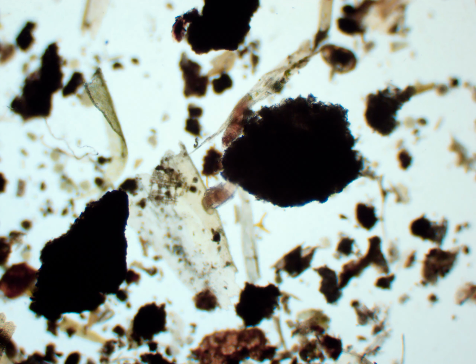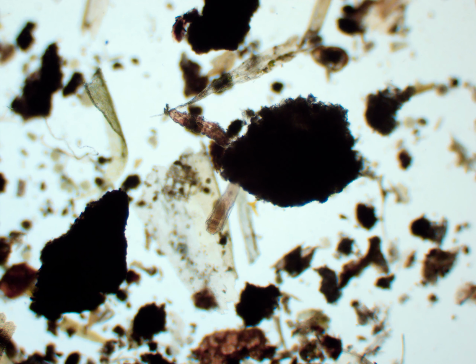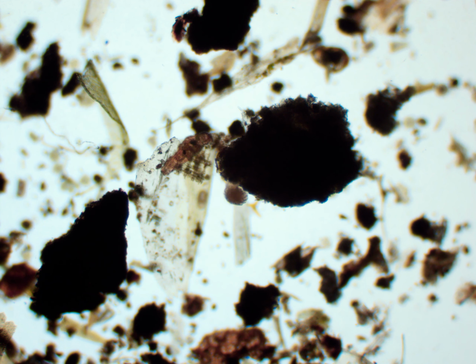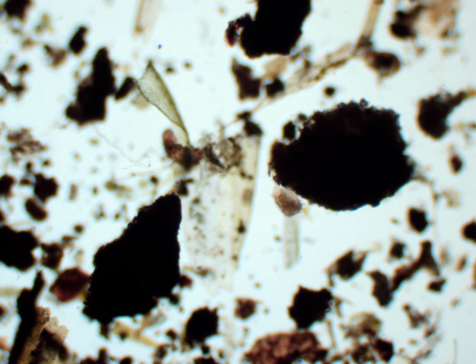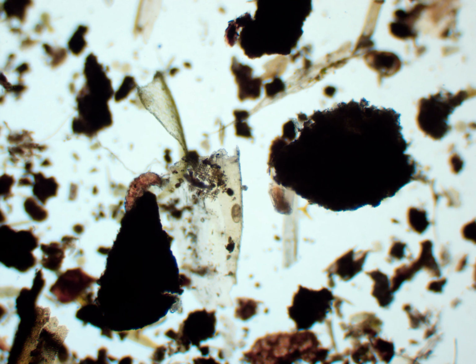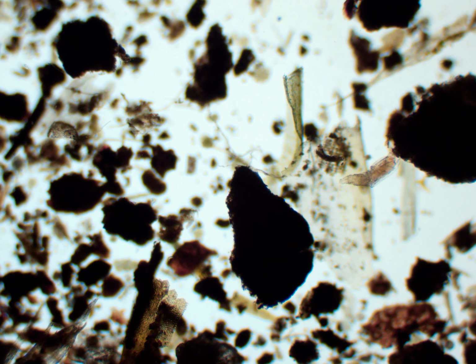And here you can see it with a bdelloid and see the size comparison. This bdelloid is about the same size as the tardigrade. There was actually a larger bdelloid on this slide too, which was larger than the tardigrade, but that wasn't a very good comparison since that was a very large bdelloid rotifer.